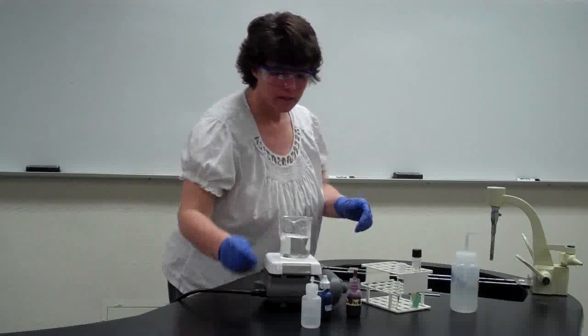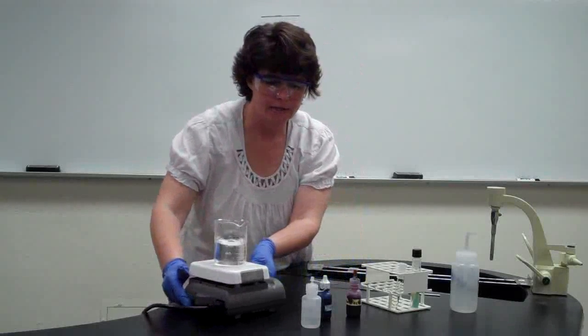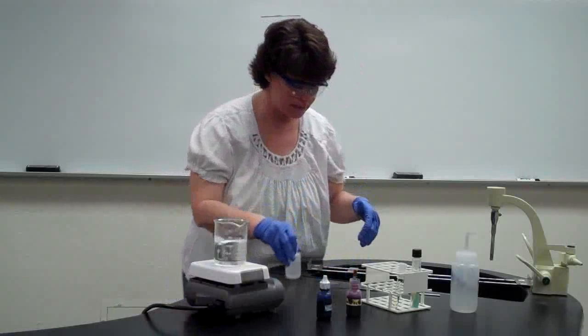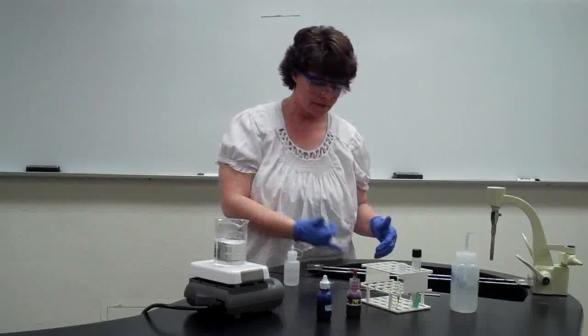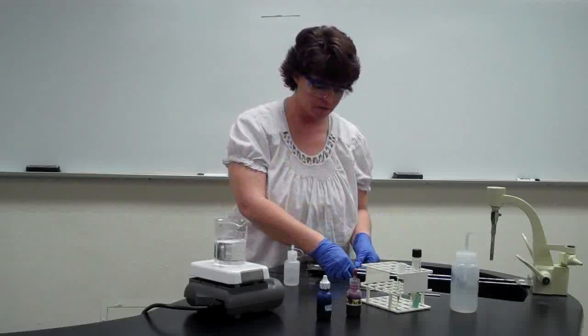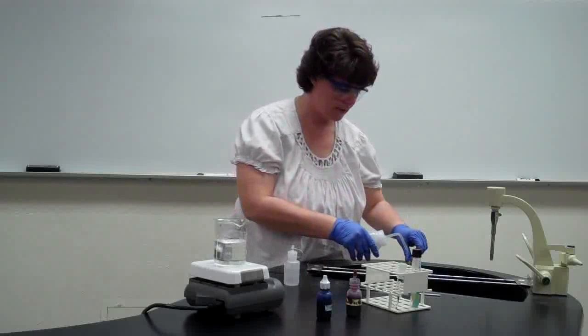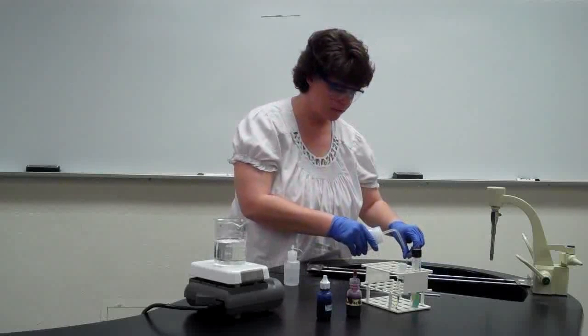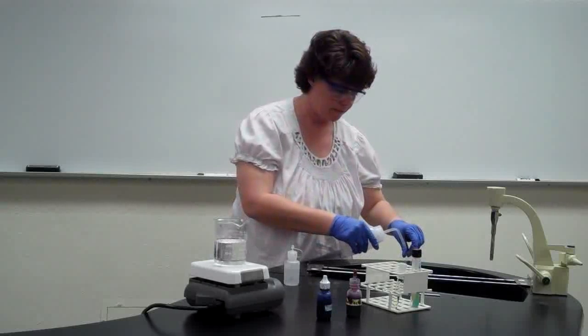While that's cooling, let's go ahead and just kind of move this guy out of the way and talk about the next step. So that's the carbol fuchsin for 5 minutes on the steaming. Now this is going to get rinsed off as soon as it's cool enough. So if it's cool to the touch, it's probably cool enough. So I'm going to go ahead and take my water, and I'm going to rinse it just as we did with the gram stain procedure.